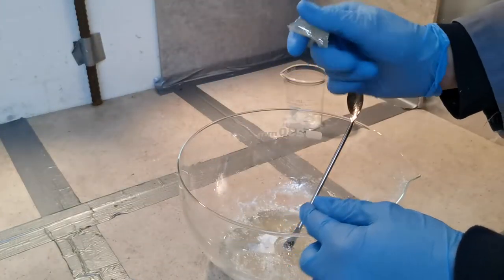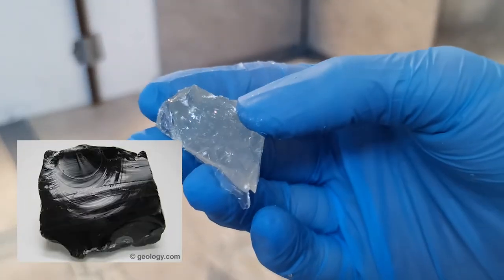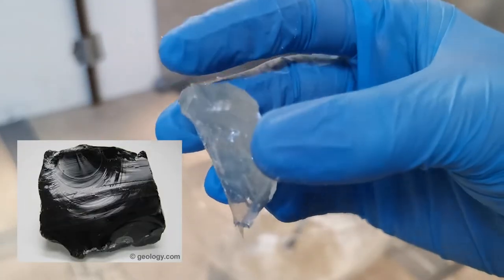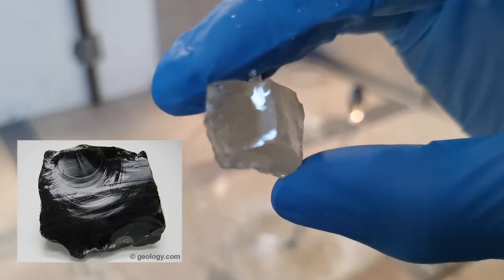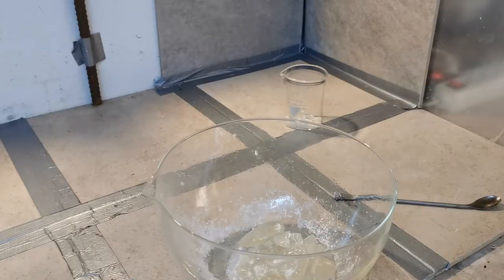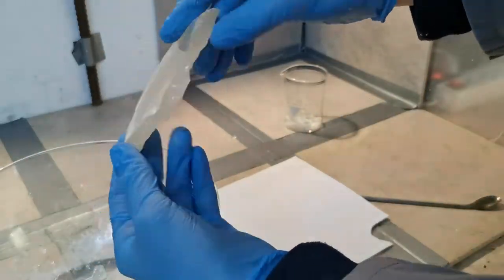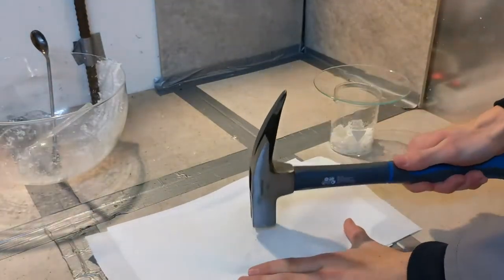Interestingly this solid was really glass like. And on the fracture sides you could see the same pattern that normal glass and things like obsidian have when broken. Once I finally got the acetate out I had to crush the huge chunks with a hammer and then powderize it all with a mortar and pestle.